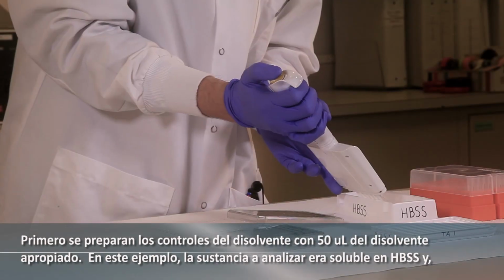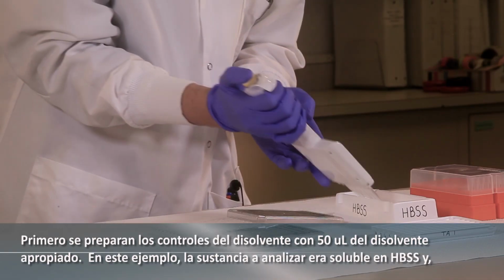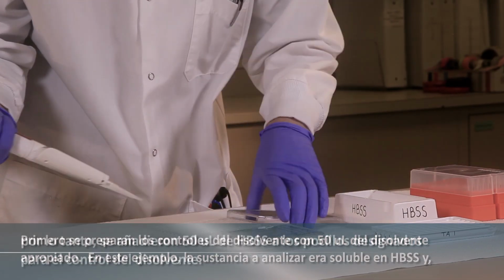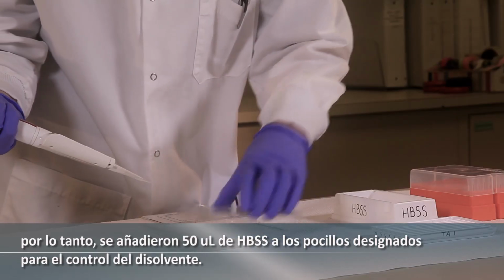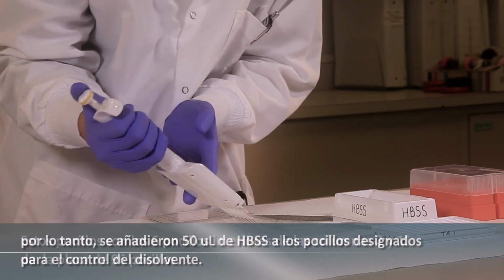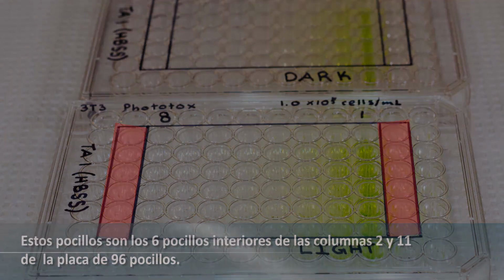First, the solvent controls are dosed with 50 microliters of the appropriate solvent control. In this example, the test substance was soluble in HBSS, and therefore 50 microliters of HBSS are added to the wells designated for the solvent control. The solvent control wells are the inner 6 wells of columns 2 and 11 on the 96 well plate.